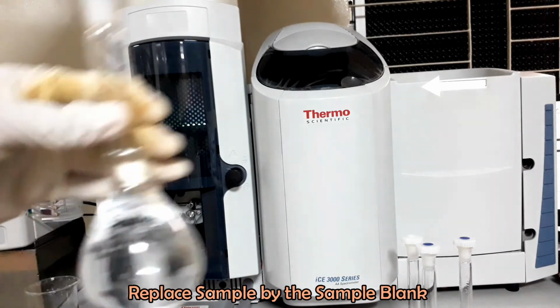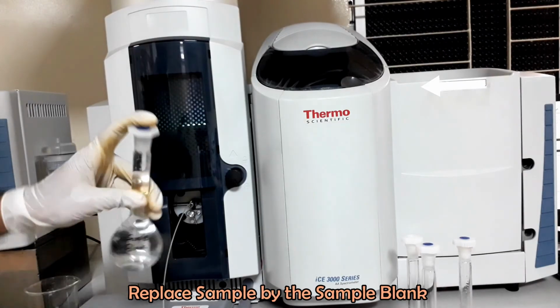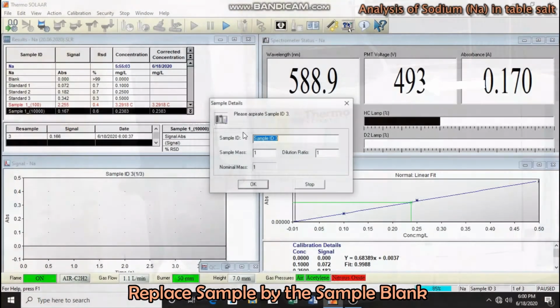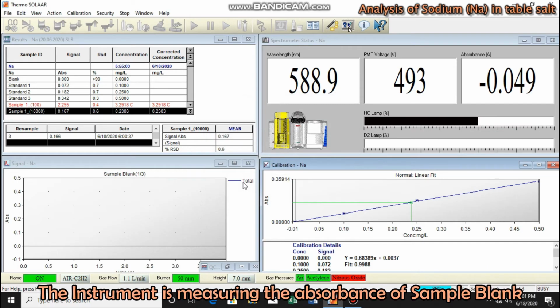Now replace the flask with sample blank. Rename sample ID as sample blank and click OK. The instrument is measuring the absorbance of sample blank.